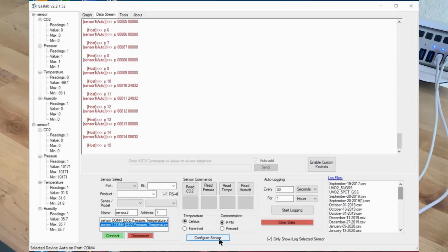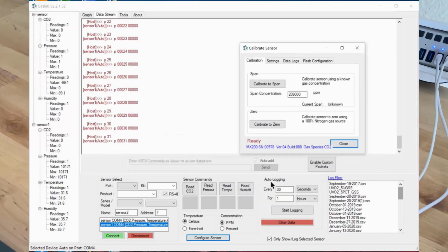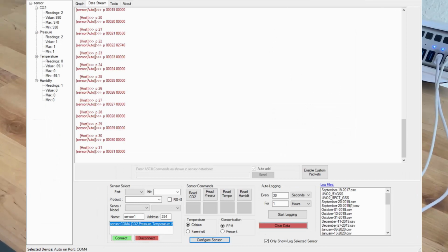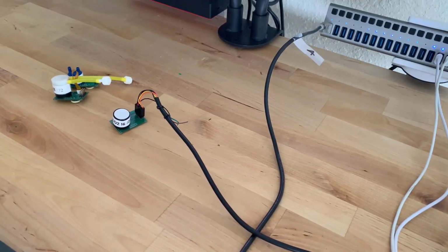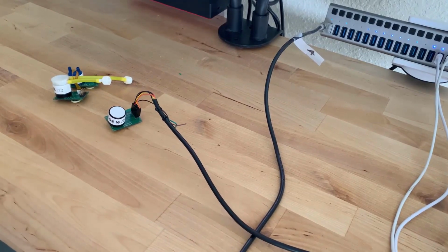If we go into the configuration menu, which brings up all the registers and so forth that are in these devices, we come up into this corner here. Let's get it up so it's useful. We want to move it around. Let's see what else is going on. We go into the settings, and it tells us that its RS485 address is address 6. There's a bunch of other settings in here for data logging and so forth, but for the time being, we now have this device, and it is addressed. We'll repeat the process with any of these other sensors, and that's what we do to configure them.